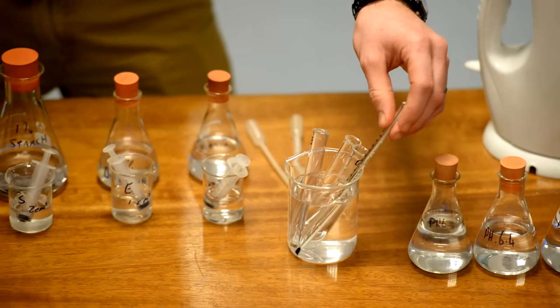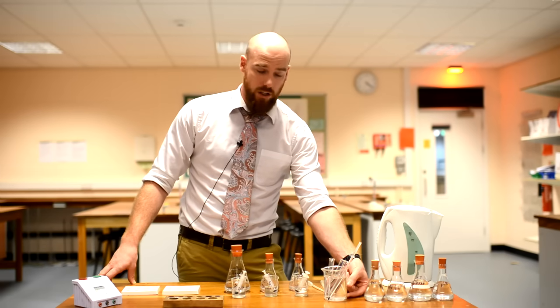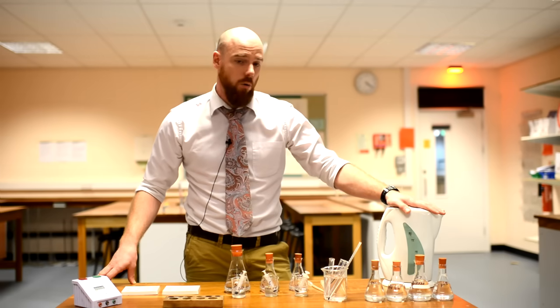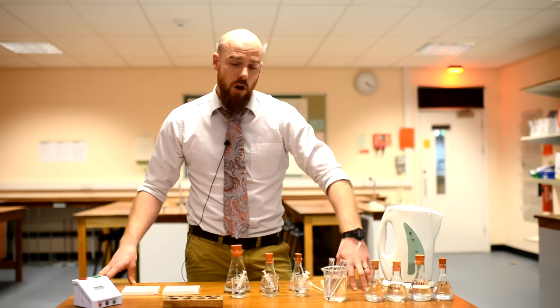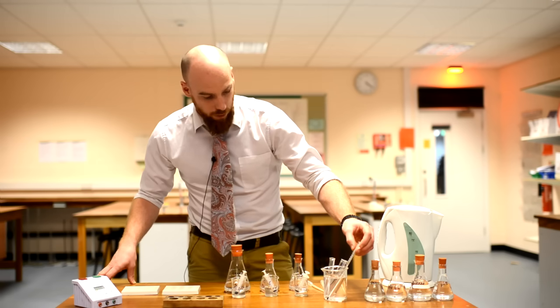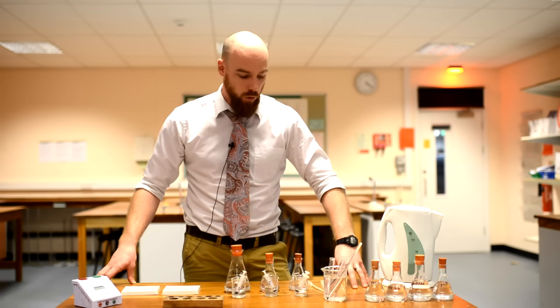The best way to achieve that temperature is to part fill the beaker with cold tap water and then use hot water from the kettle to bring the temperature up to about 30 degrees. Throughout the practical you need to monitor the temperature of the water bath and adjust it with hot or cold water accordingly.